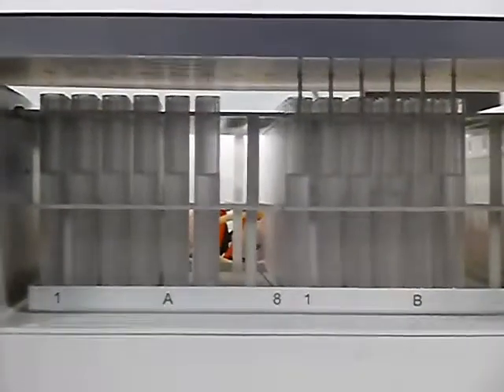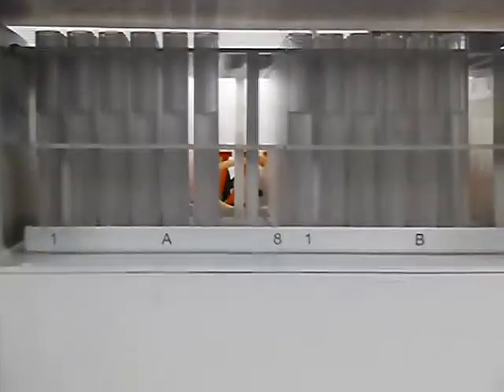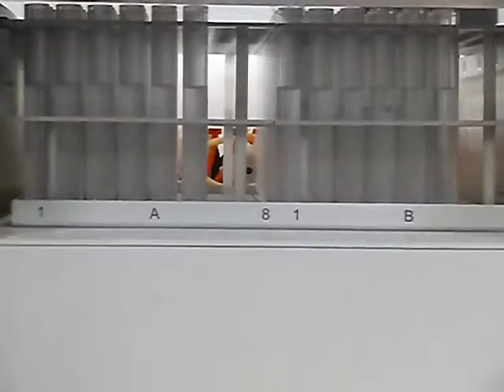More than likely, because you've already got the volume that you want, it may still give you the same problem with volume, because you're at a slow enough speed for the pistons.